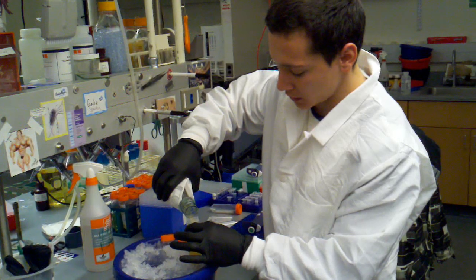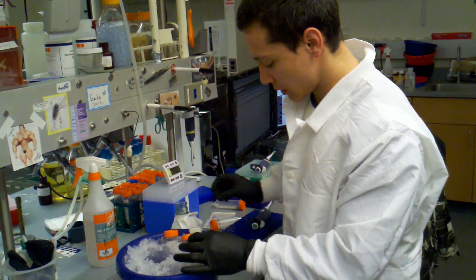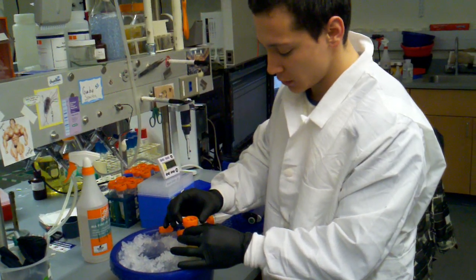Pour it on in. A little bit more than 50 which is cool. And cap it. Cap is labeled.